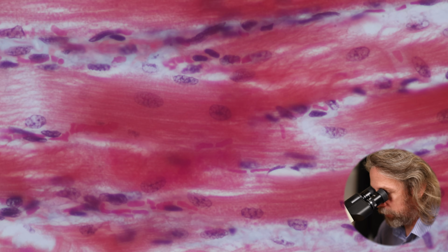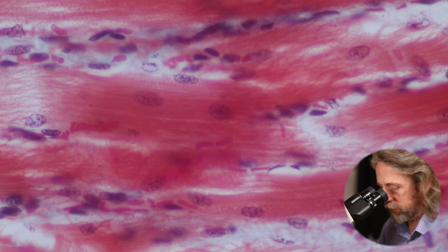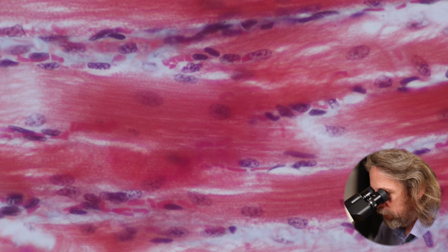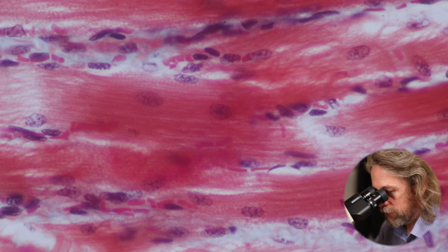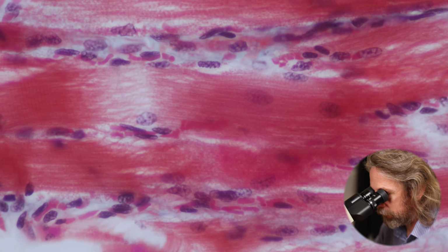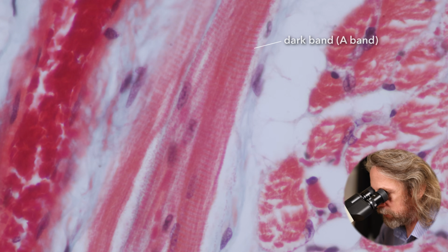So the nuclei there look like they're inside the cell because that's just the plane of section. They're on the outer edge of the cell. It's just the shape of the tube that we're looking at. But you do get a sense, don't you, I think, of not just the stripiness, the banding, the striations, but you can see the filaments inside the muscle there. Okay. There's some good striations in there.